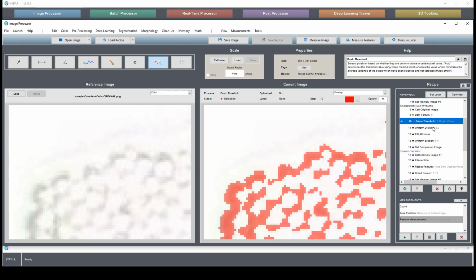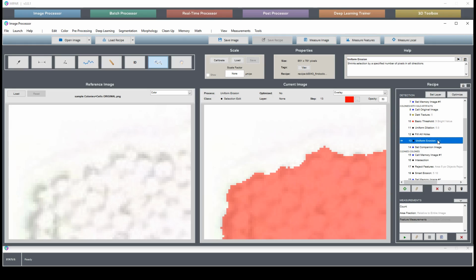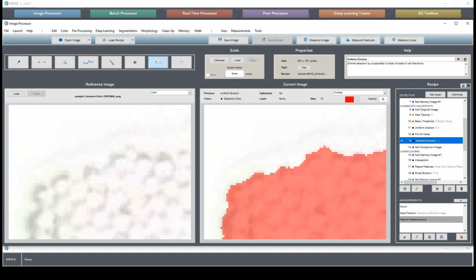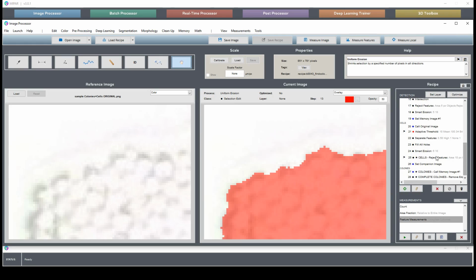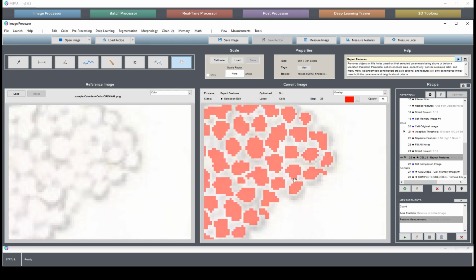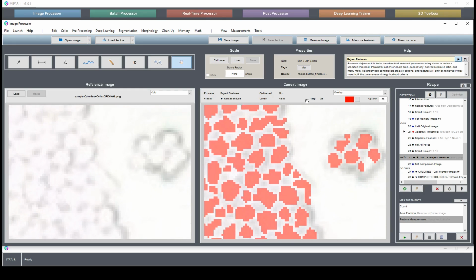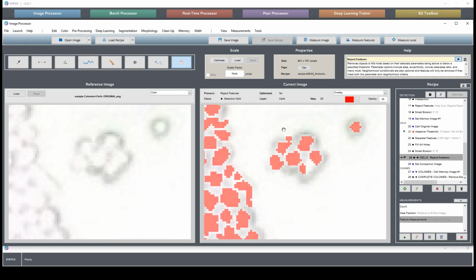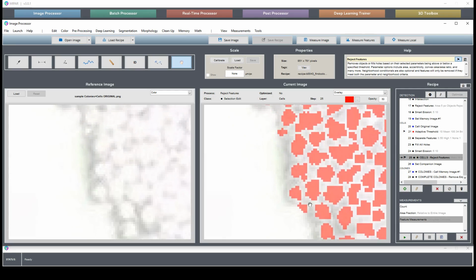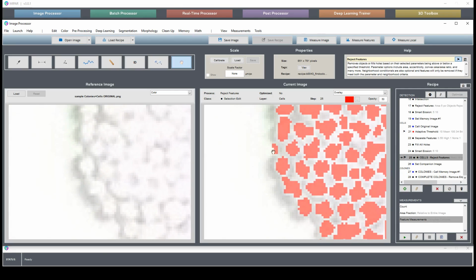A morphological closing, which is what you call a dilation followed by an erosion, has a tendency to fill in tight concave pieces like this. And that's why we end up finding a cell here. I don't remember if we find a cell here or not, but throughout these colonies, there are places where this selection is made inappropriately. Okay, this here. And there's a few more, including this tiny little piece, which doesn't fall into a cell count because it's part of this one feature. But this pretty significant piece here, this one here is correct, but this here shouldn't be found.